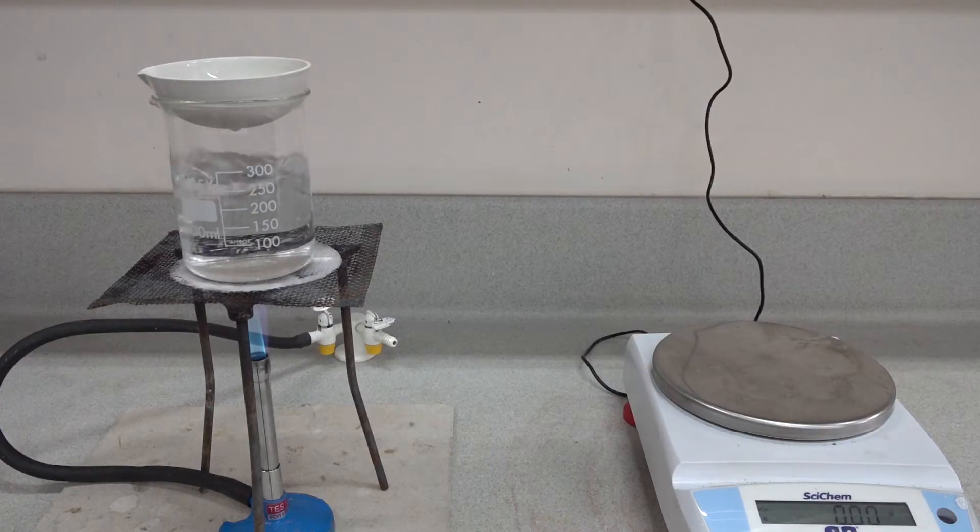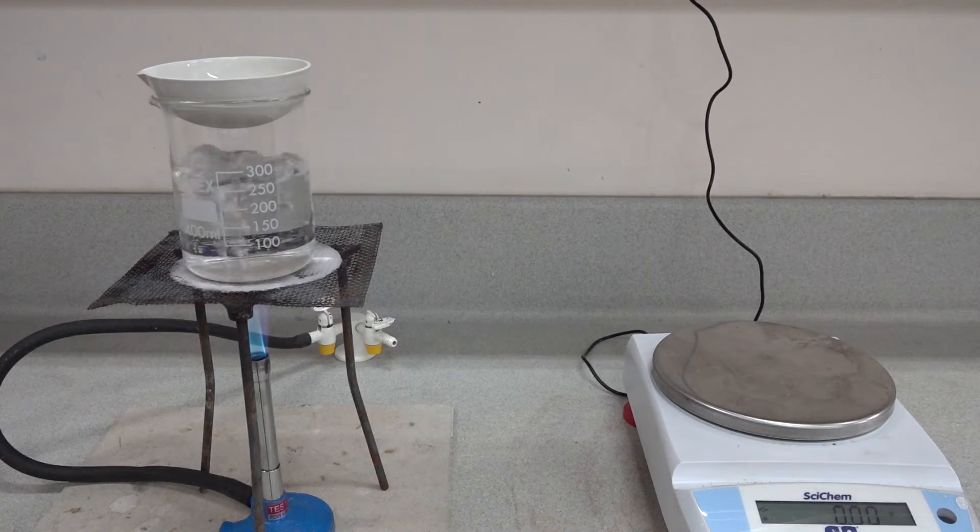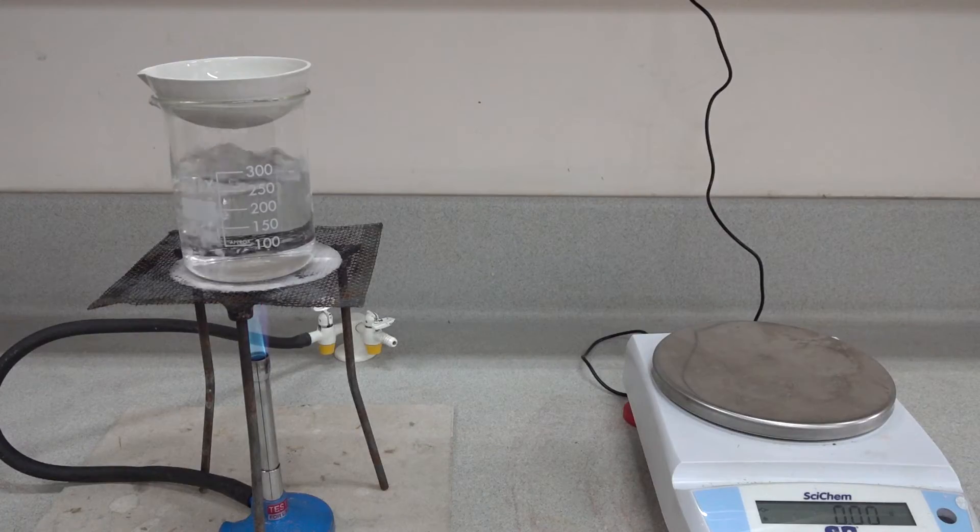Although you can't see in the evaporating basin, the solution is evaporating quite rapidly. We've already formed some solid around the edge and it shouldn't take too long.